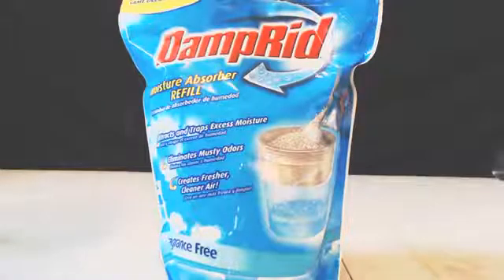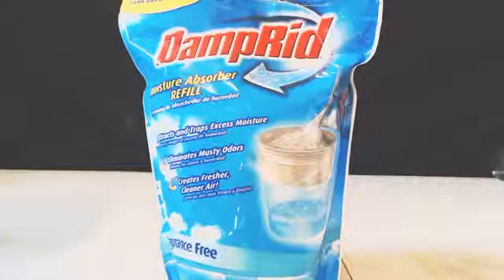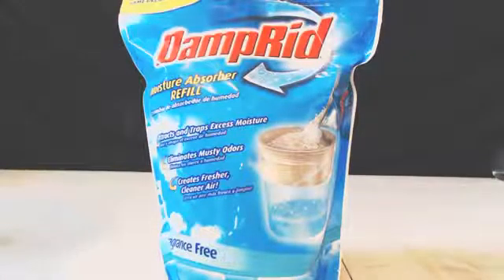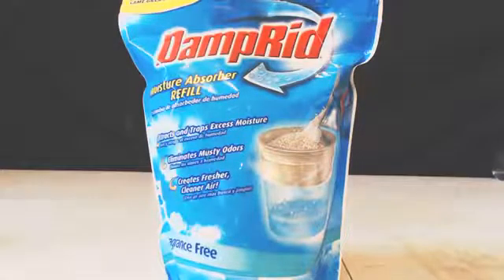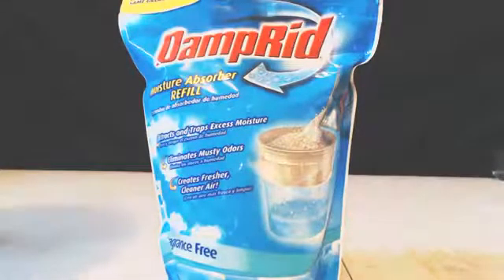This is John Black, super chemist, another easy simple video showing how to get anhydrous calcium chloride. Now this is not a pure product. This is what the MSDS says on DampRid. As you can see, the percentages don't add up really. I mean it could be 60 and 5 and 5 is 70.